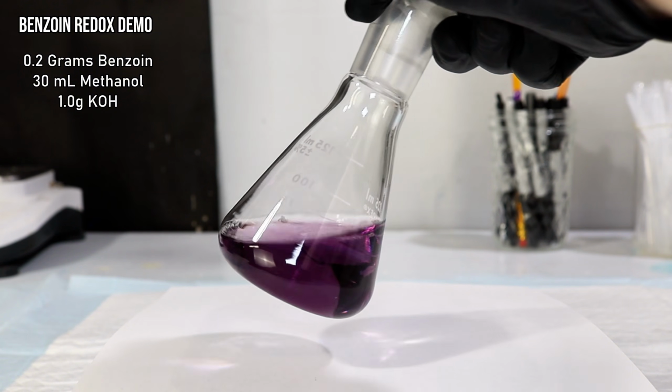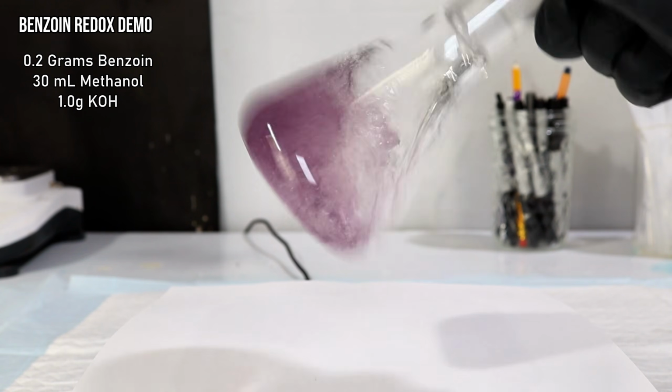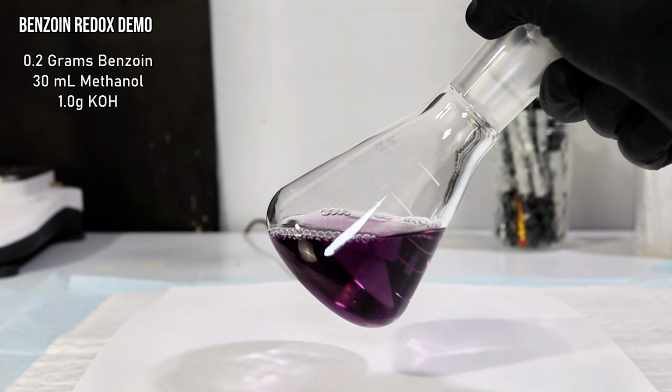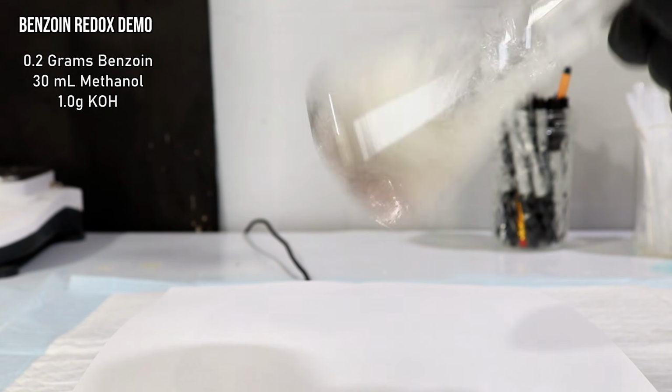This is probably the only organic redox demo I've ever seen that doesn't require an indicator, and I found it entirely by accident. Again, this could be some weird anomaly considering I'm only using homemade reagents here, so if you happen to have some pure benzoin lying around, let me know if this works.